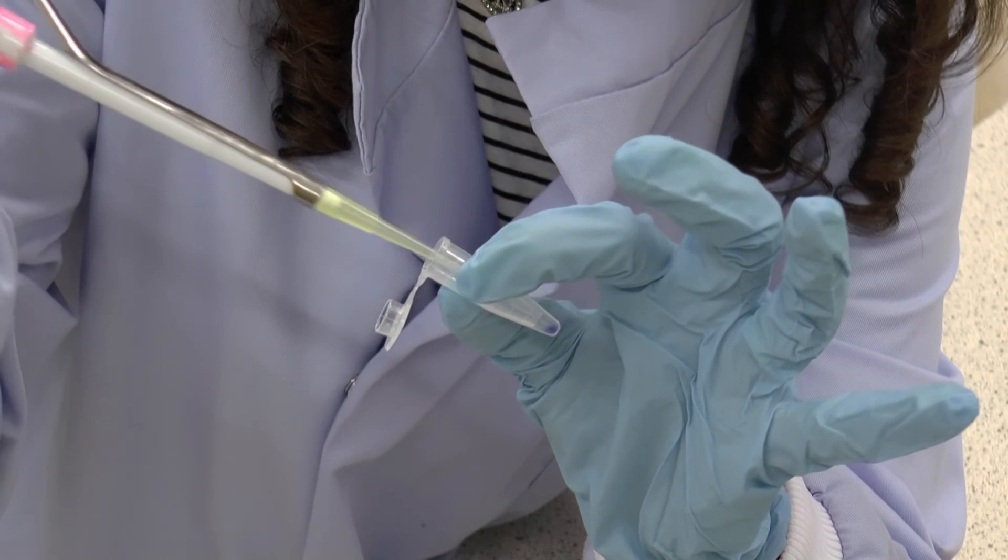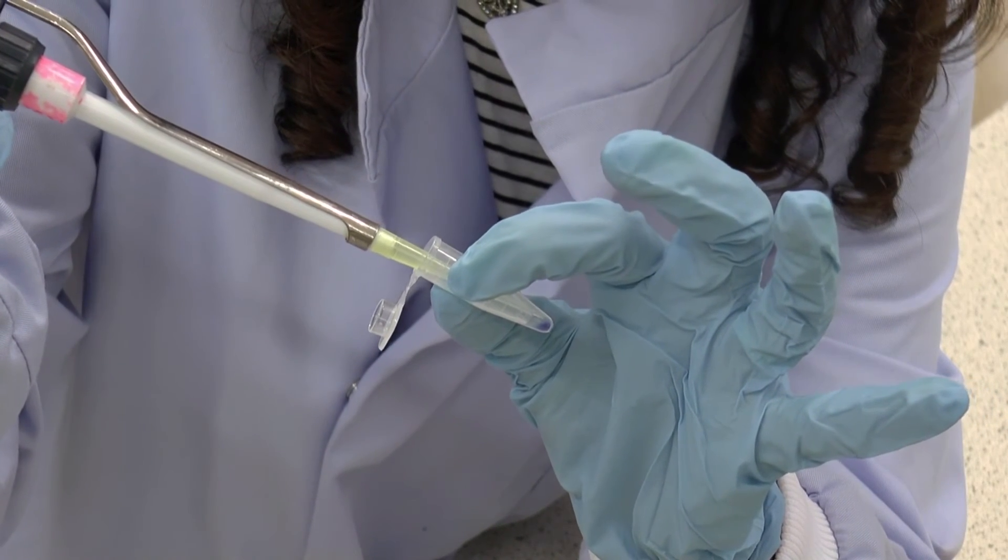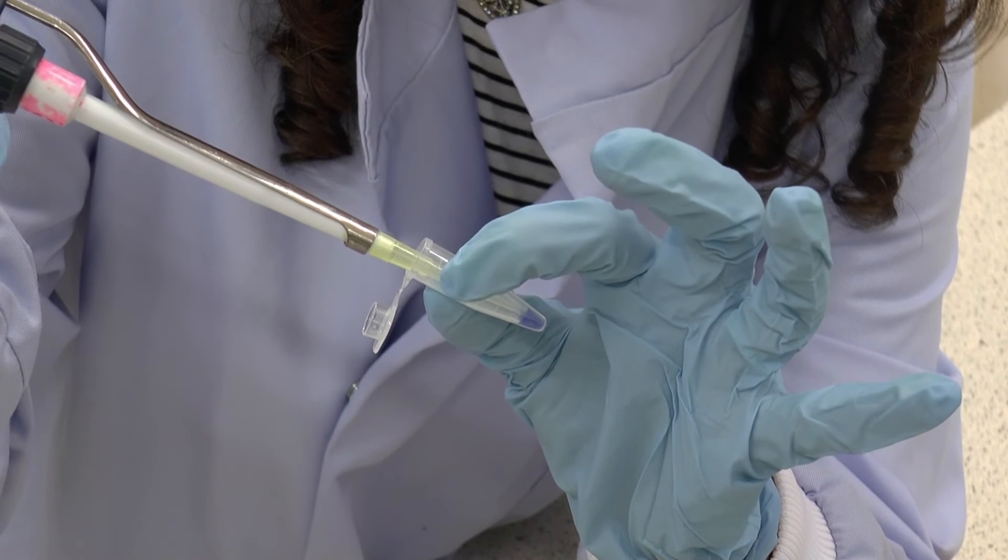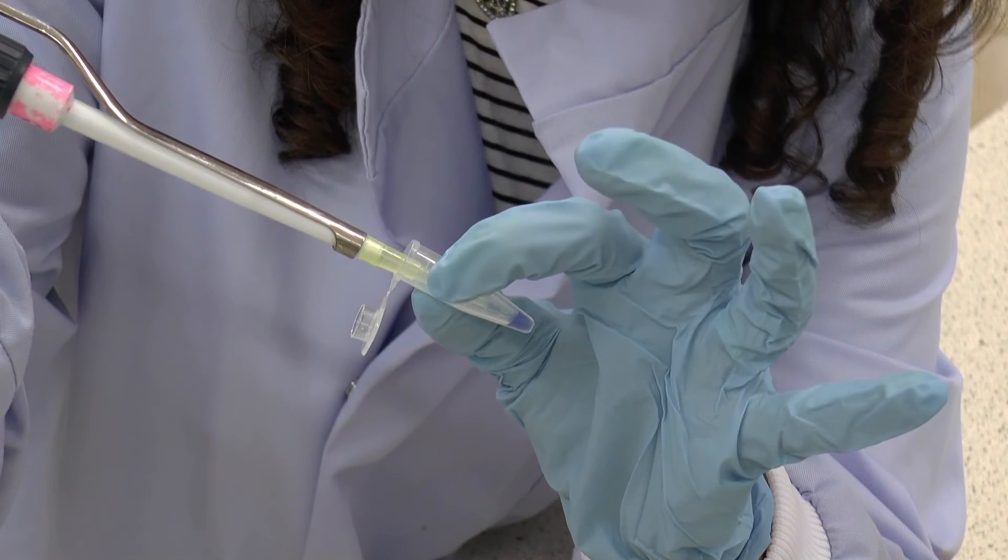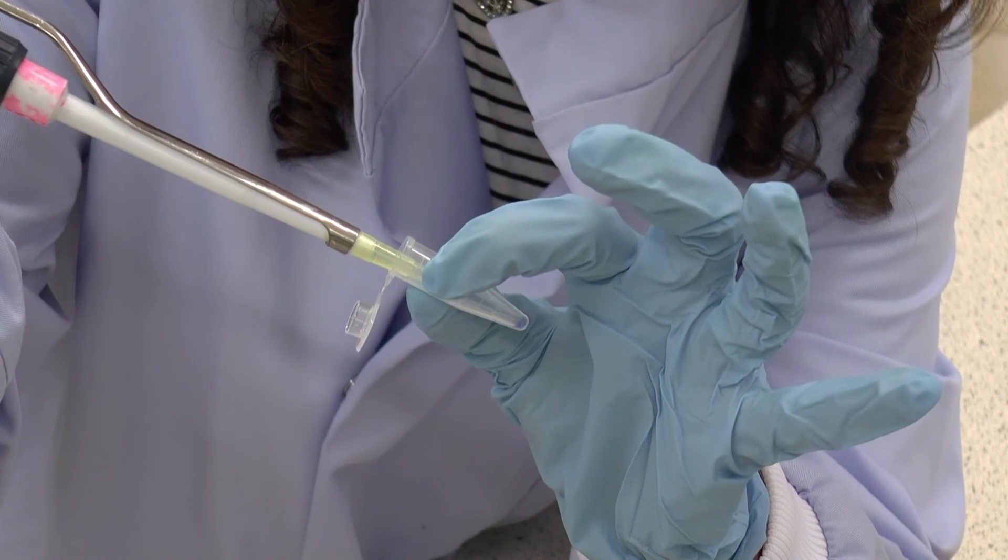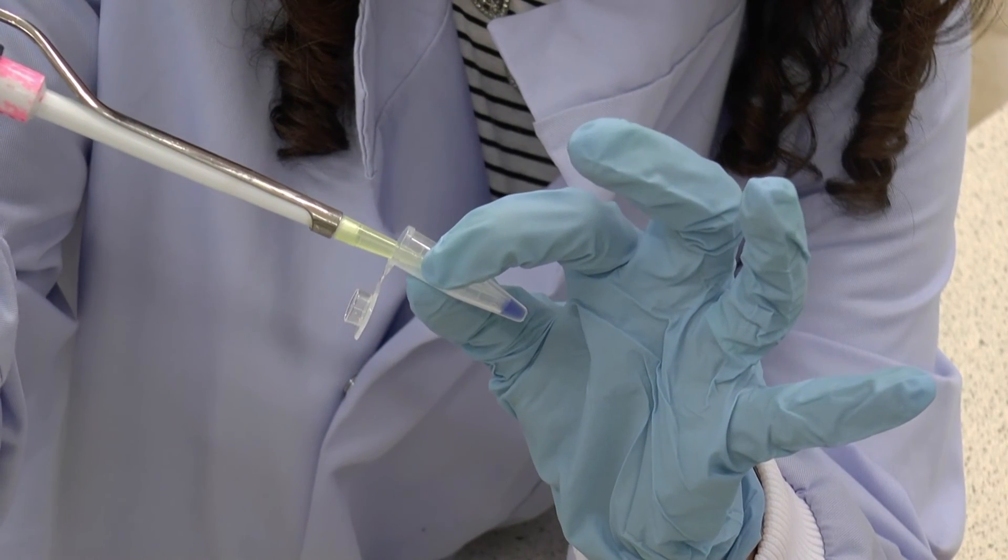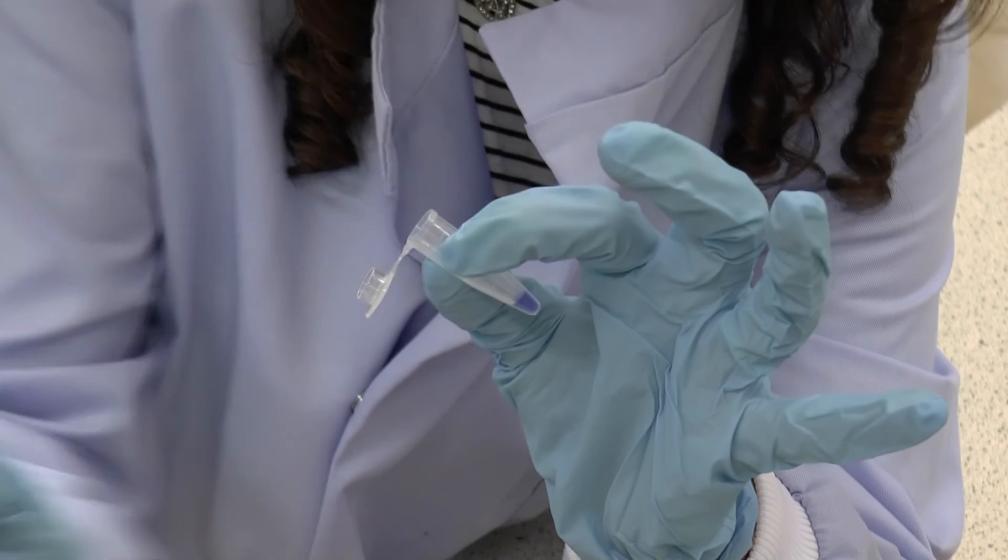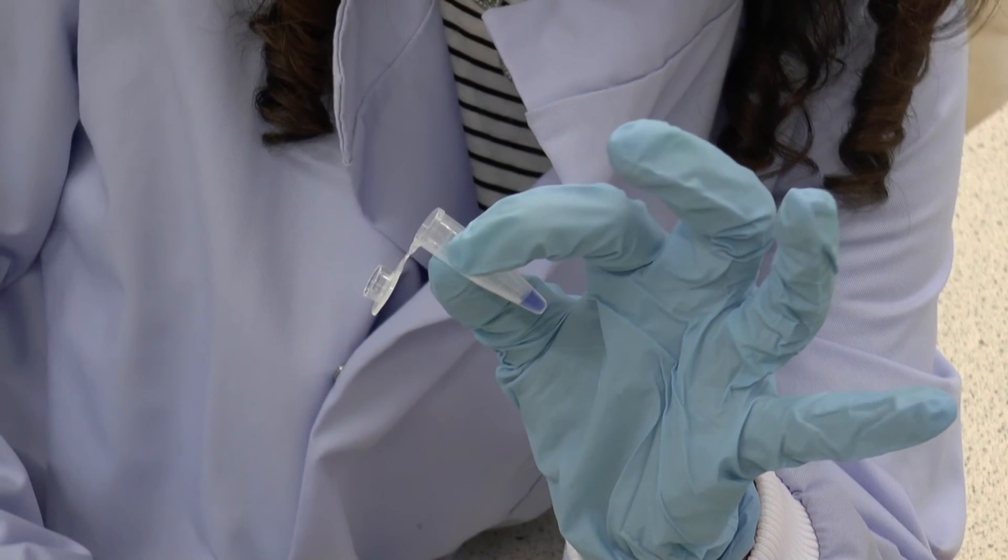So it's important to come back in with the larger pipette tip and mix that thoroughly but carefully a good few times so that you've got a nice well-mixed solution and your enzyme can work on all of your molecules.